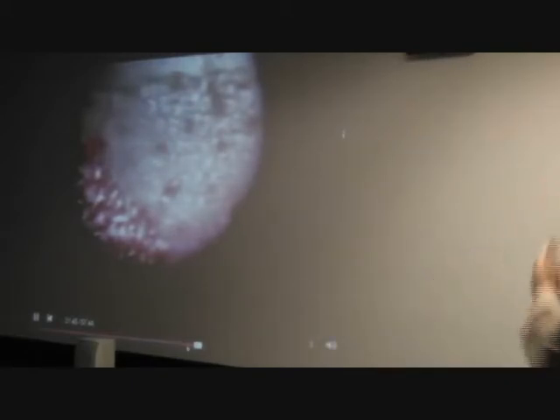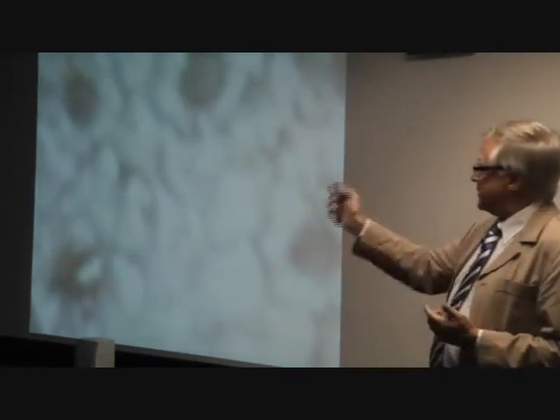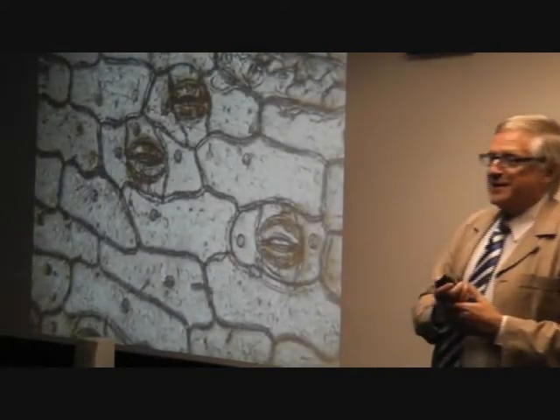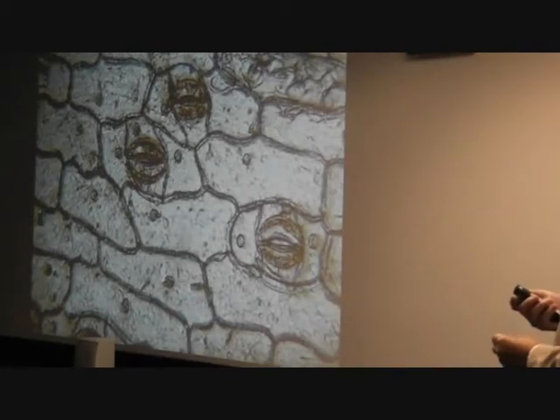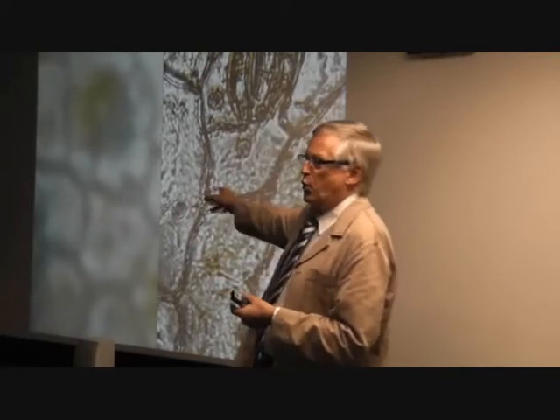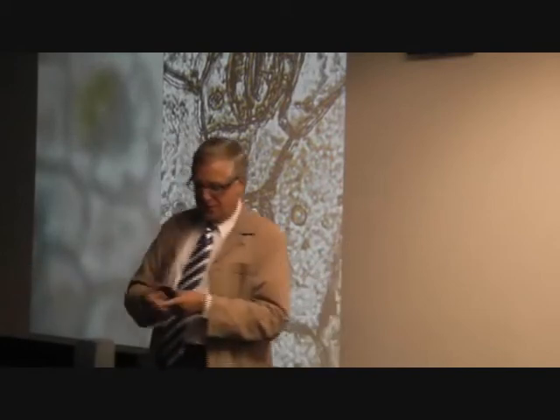Yes. Now, here is a still frame. It's better on the small screen. But here is a still frame of what they saw. Now, the image to which the esteemed Mr. Haddix is alluding is this one, which is the same specimen that I imaged through the same lens on the same microscope, and which I was honoured to win a prize for last year. If you put the two together, here you can see my own amateurish, ill-informed, and quickly run-off experiment alongside the BBC's magnificent technical achievement.